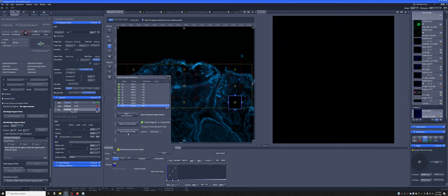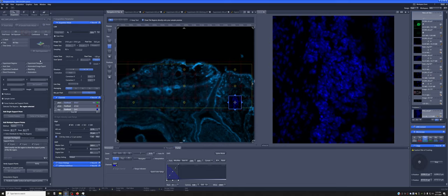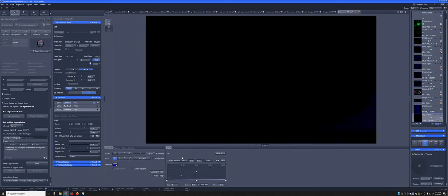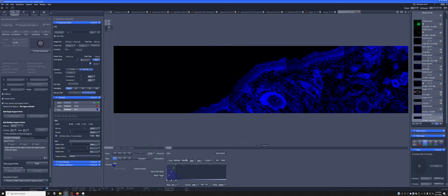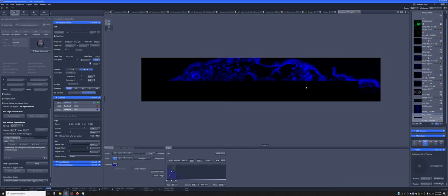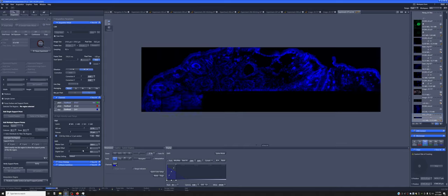This looks good. Okay, so now once all points have been done, we have this focus map, and if we say start experiment, it will take images taking into account these differences in focus. So it's not taking them all at the same position, it's taking them sort of tilted, making them overall quite even. If we tried to do this without this focus support surface, what we would get instead is just only the middle in focus.